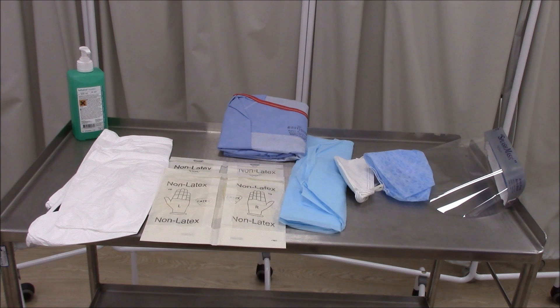This video is designed to demonstrate the procedure for donning and doffing the personal protective equipment used when managing a patient who has been risk assessed as high risk for Ebola virus disease. A trained observer must visually monitor for correct PPE use during this process, in accordance with current national and international guidance.